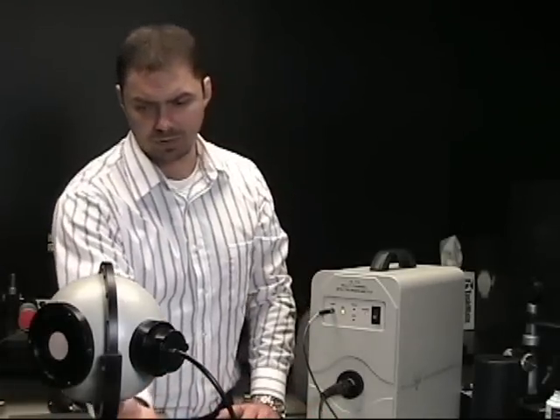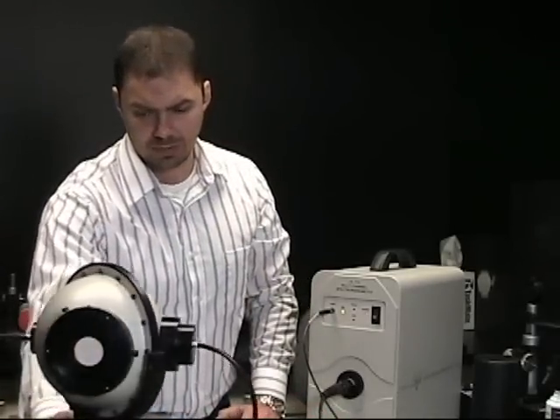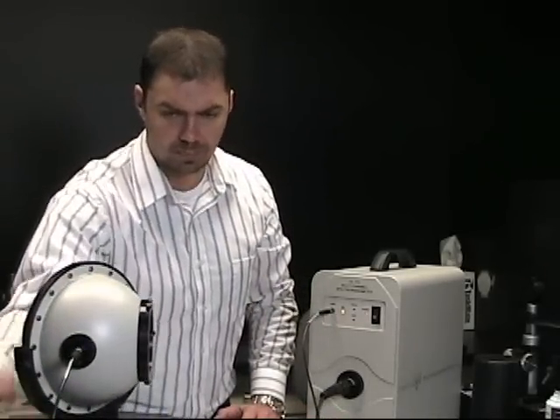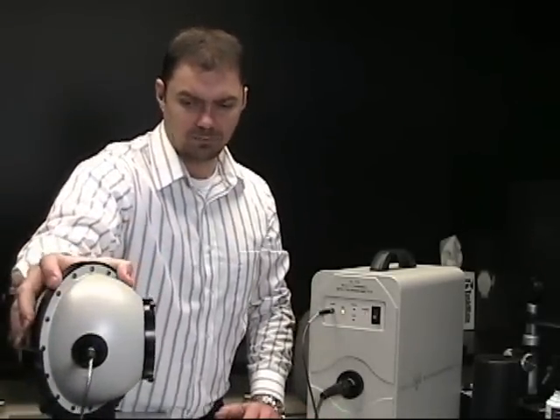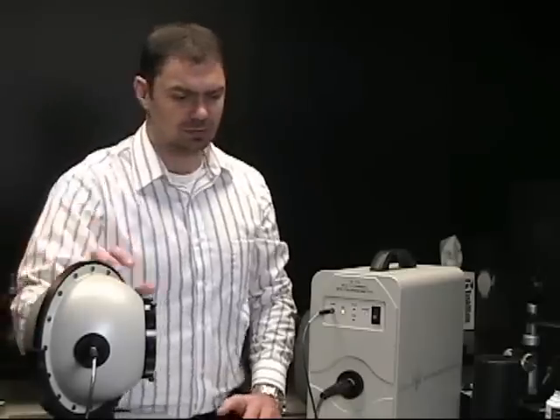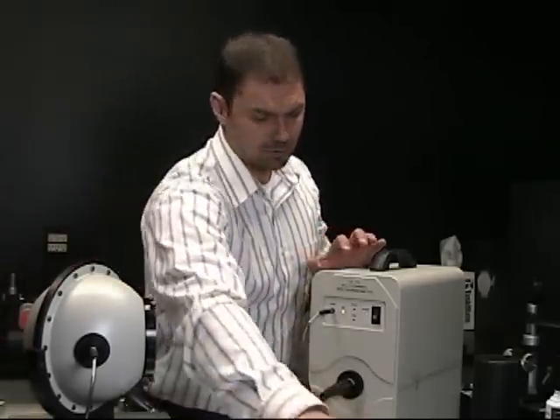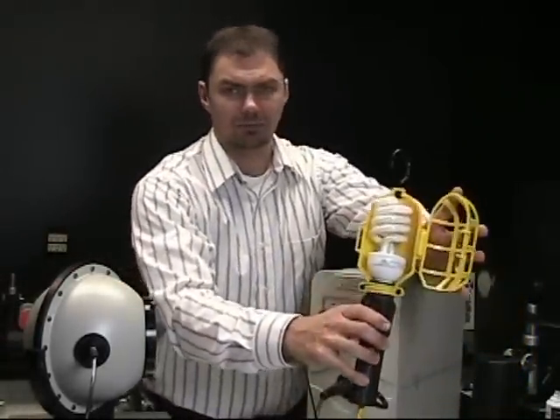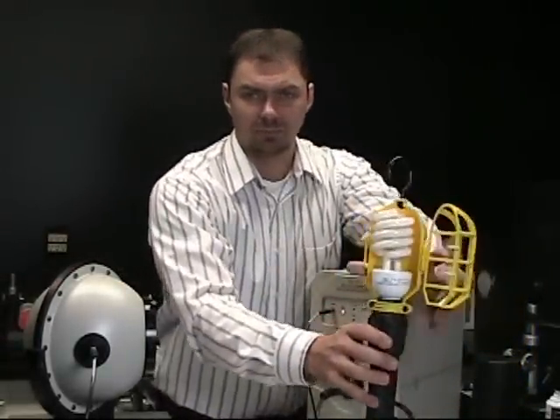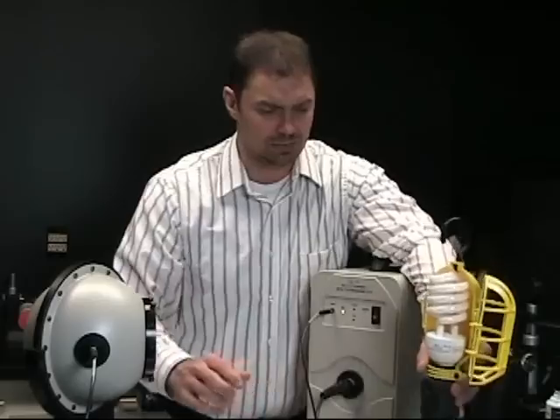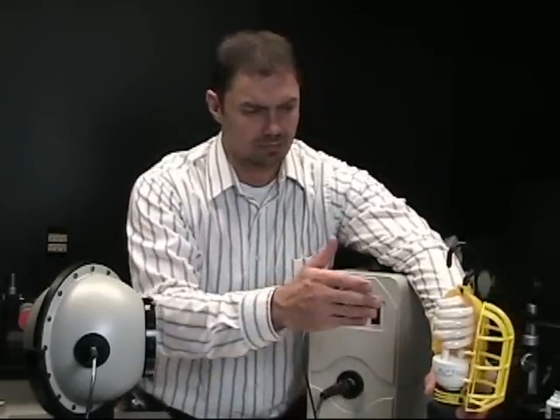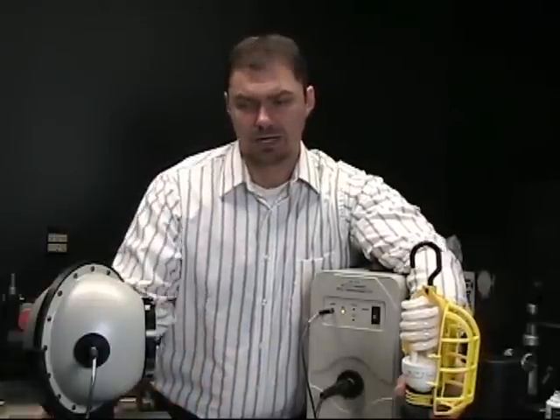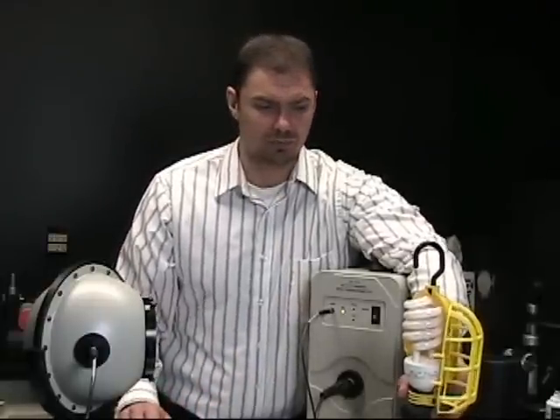We leave the same measurement fiber. I'll rotate the sphere around. Essentially what we need to do now is we're going to be looking at a fluorescent lamp. What we need to do is essentially align the lamp, both in the x and y direction with the center line of the port, leaving the same configuration we had before.